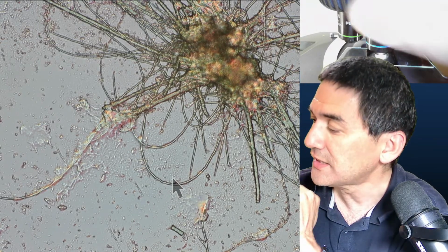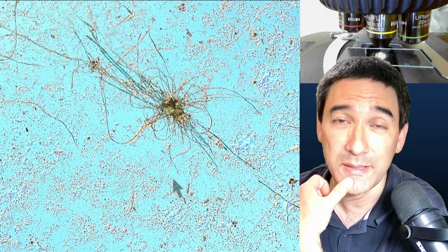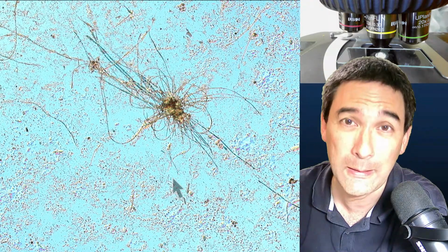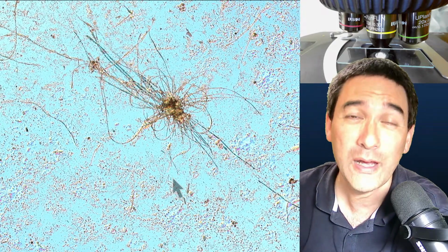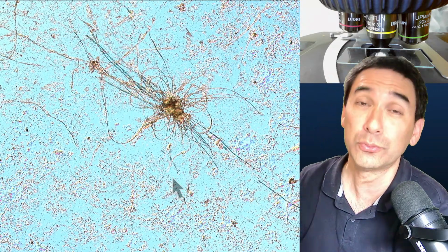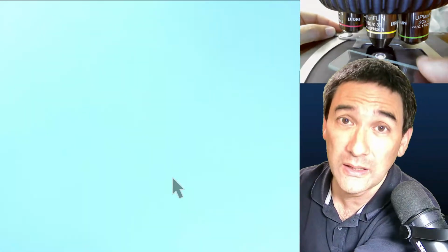Generally speaking, and that's maybe one of the things one has to consider, for delicate water specimens like algae, cyanobacteria, and so on, you generally should use a mounting medium called glycerin gelatin, which is a semi-solid mounting medium. The only problem with that is it's horribly difficult to use. You have to warm it up to 45 degrees centigrade, because it's solid at room temperature. You have to warm it up carefully. If you warm it up too much, it's going to break. Break means that it won't become solid anymore, because the gelatin will break if the temperature is too high. So it's not ideal.